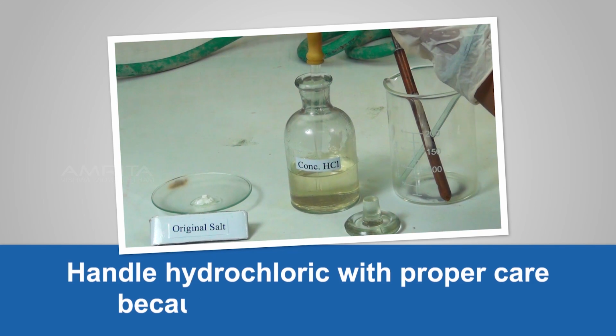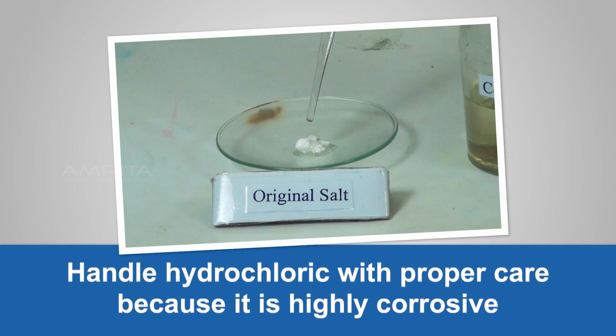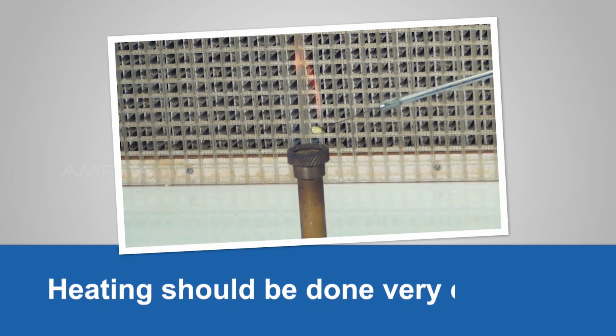Precautions: Handle hydrochloric acid with proper care because it is highly corrosive. Heating should be done very carefully.